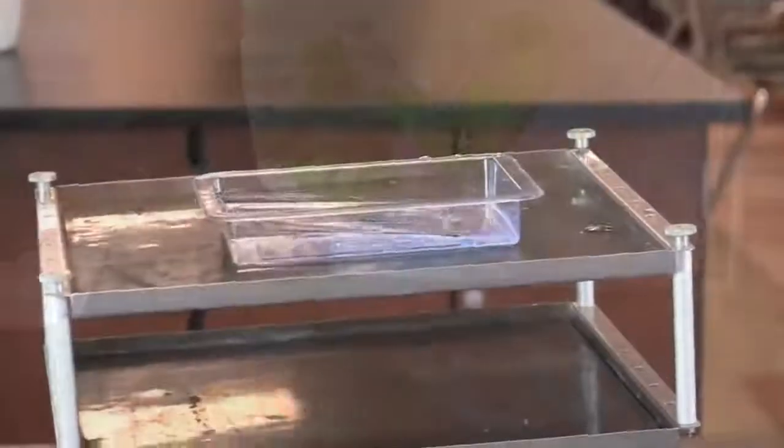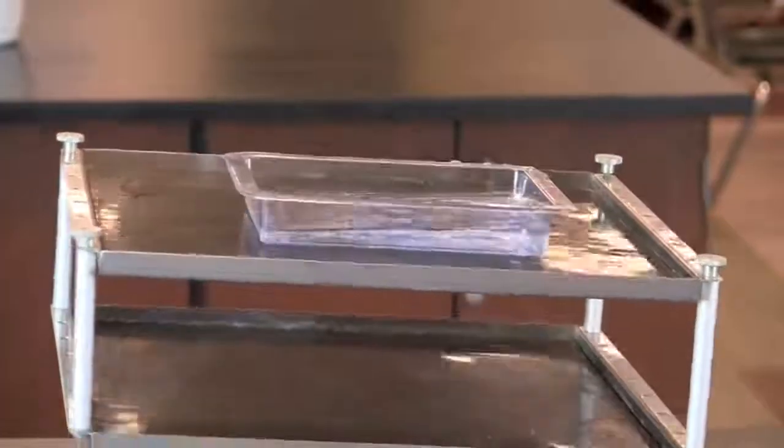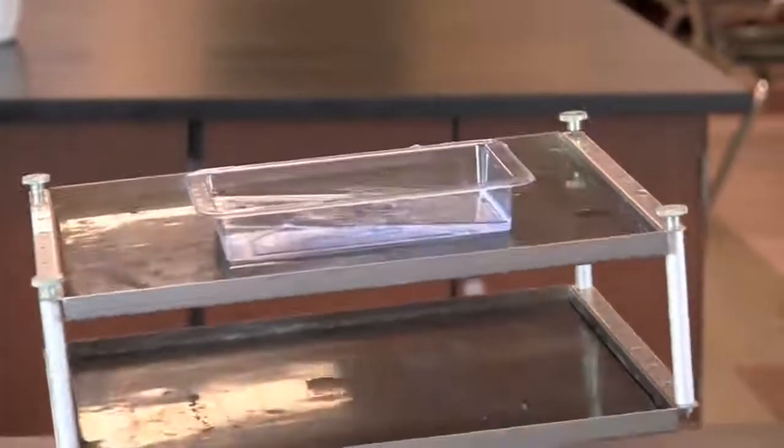After trimming the top and bottom of the gel with a straight edge, equilibrate the gel in the tray with blotting buffer for 15 minutes on a rocking platform.